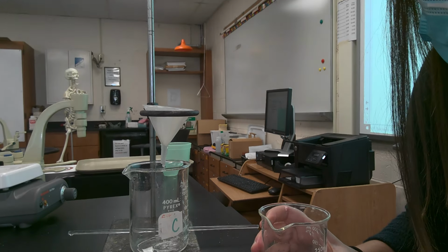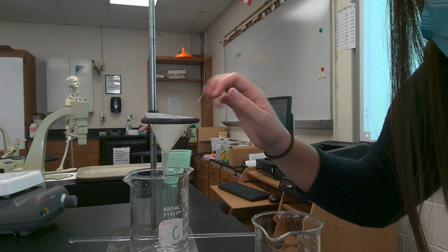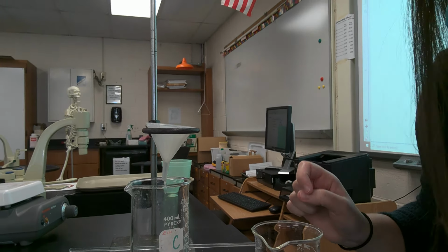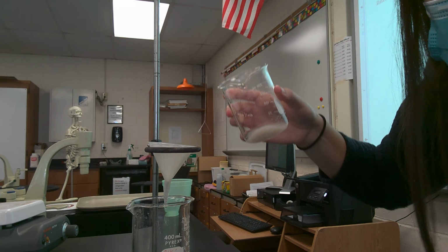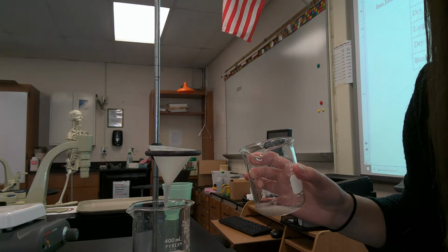And if you could see the dripping, guys, the sand is solid, so it's going to get stuck in the filter paper, and the salt water is coming through. Okay, so I'm just going to take some time to get all this out. And see how the sand is going to get stuck in the bottom of the beaker? So we want to make sure that we use our squirt bottle and get as much of that sand as possible into the filter paper, because again, we want to weigh it at the end.